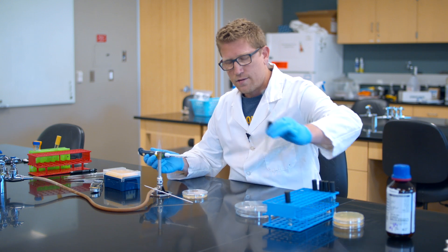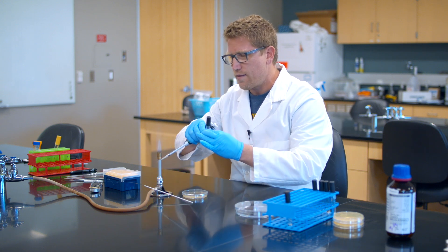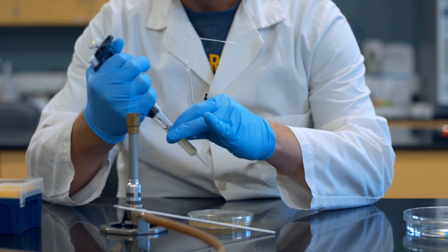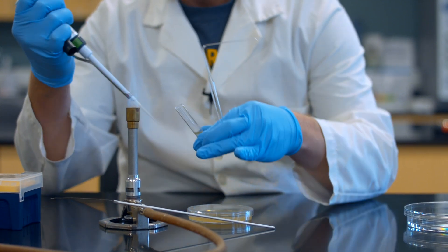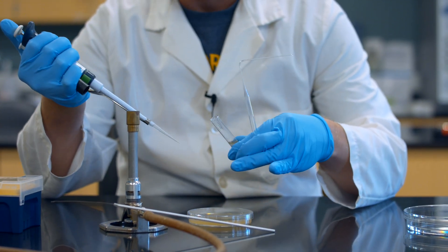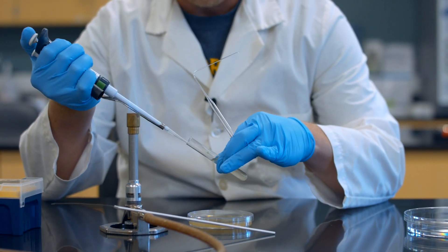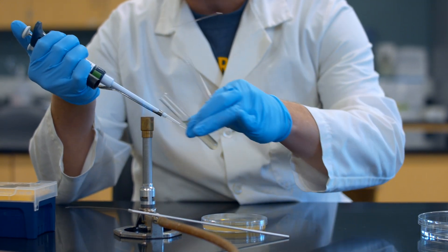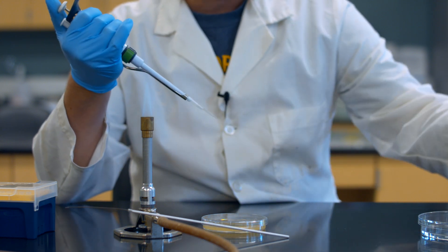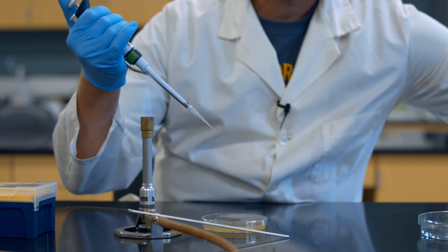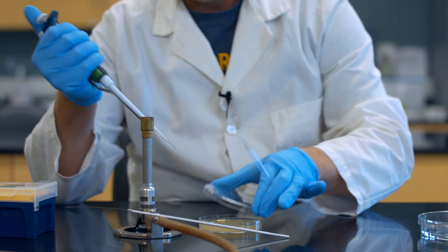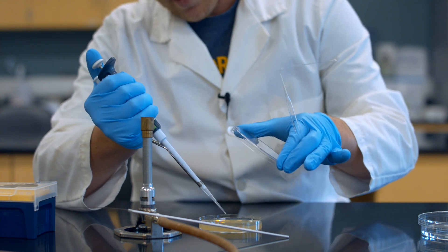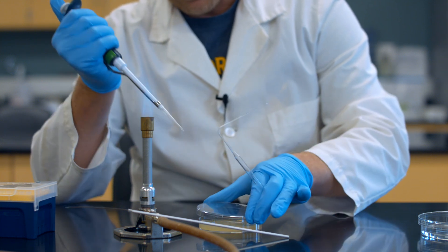I'm going to grab a little bit of my E. coli over here that we had in the last video. I'm going to take the cap off and flame it. Sometimes you have to hold multiple things when you're doing microbiology. It's good to get used to it. I'm going to draw up 50 microliters. Usually that's plenty for a spread plate.